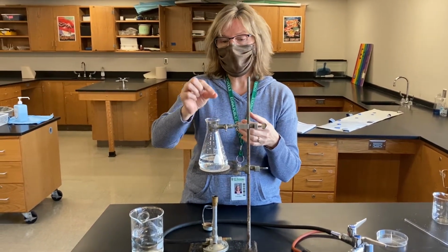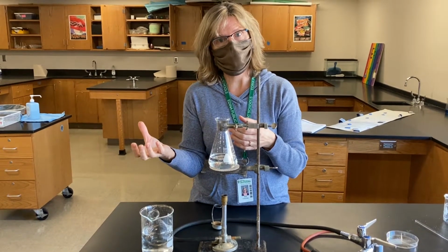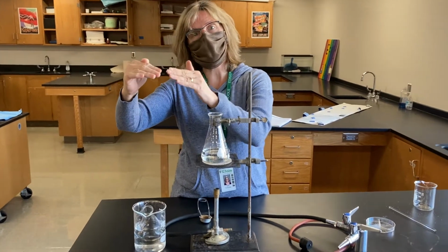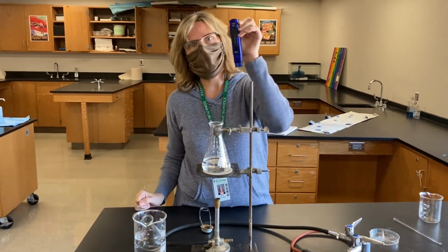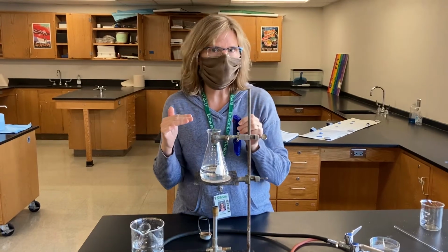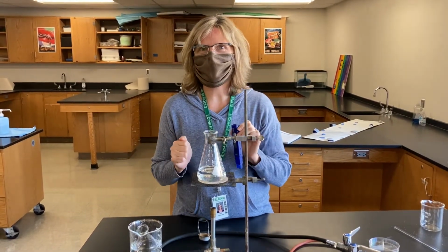And after that water has evaporated, we're going to collect it, so it'll go from liquid to gas, and then as it cools from gas back into liquid. And we're going to measure, using the TDS reader again, how that affects the salinity or the amount of salt that's there. And see how the water cycle works.